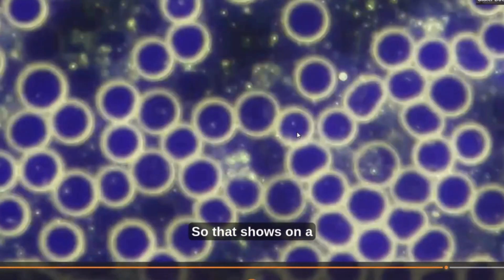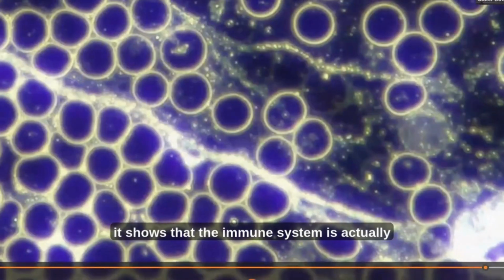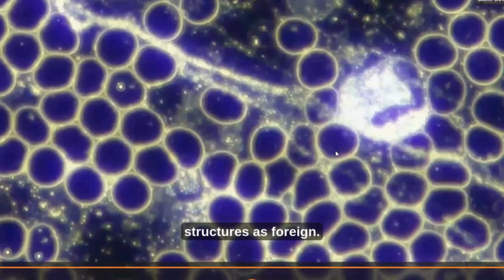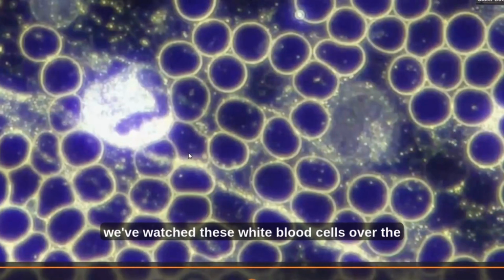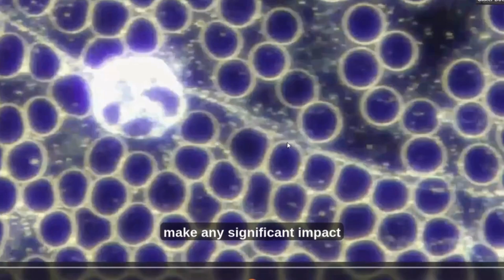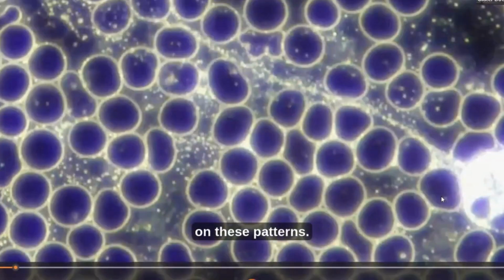So that shows, on a positive note, that the immune system is actually identifying and recognizing these structures as foreign. But we've watched these white blood cells over the course of several hours, and they don't really seem to make any significant impact on these patterns.